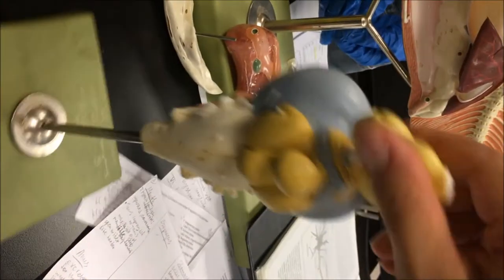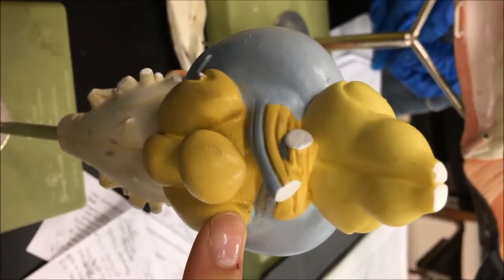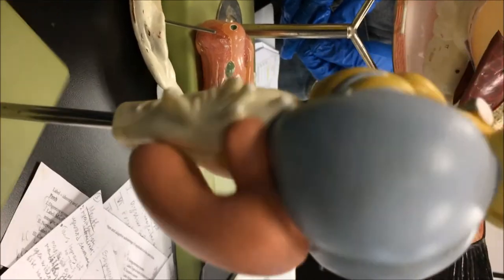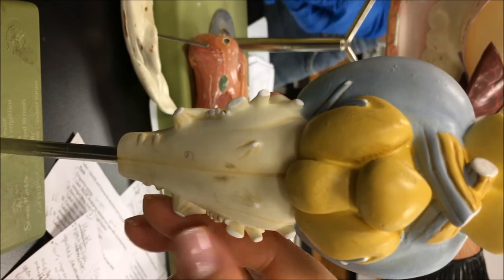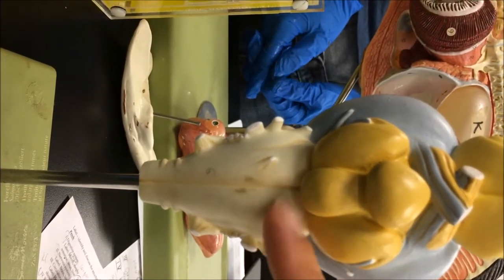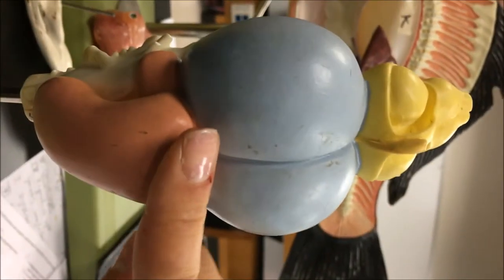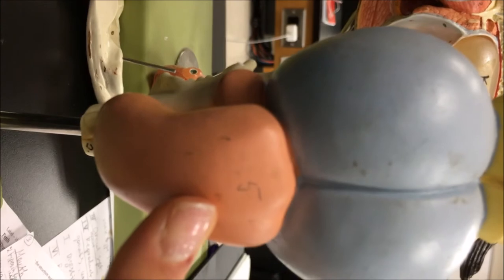This yellow part is the diencephalon. It is responsible for hormone signaling, visceral activities — which are involuntary — and muscle control. The white part, the myelencephalon, consists of the medulla oblongata, which is responsible for autonomic functions such as respiration, swallowing reflex, and heart rate. This part is the metencephalon, which is responsible for balance, motor control, and muscle coordination.